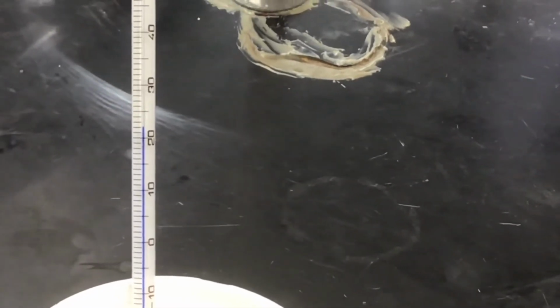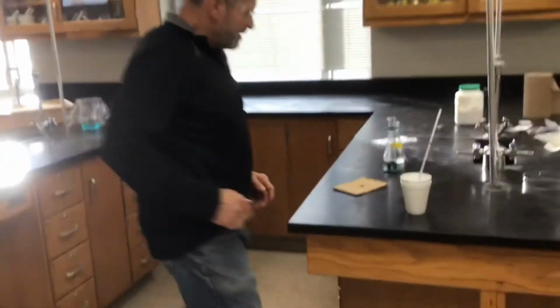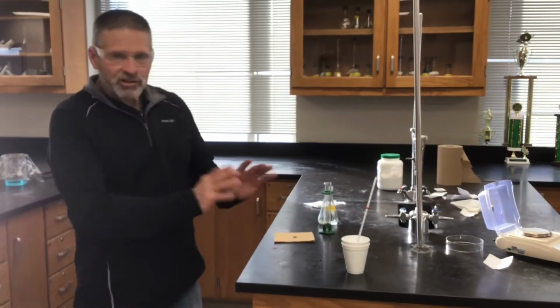We've had the same initial temperature every time. Isn't that something, Mr. Hill? That is amazing. Pretty steady. All right, so that's ready to go.